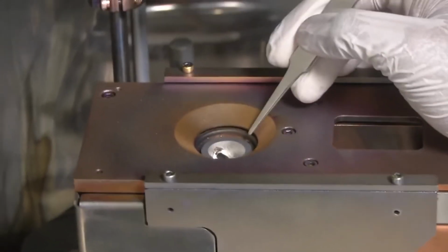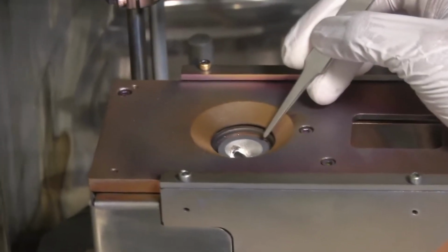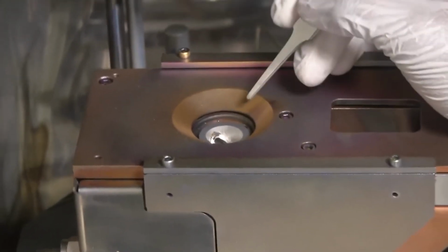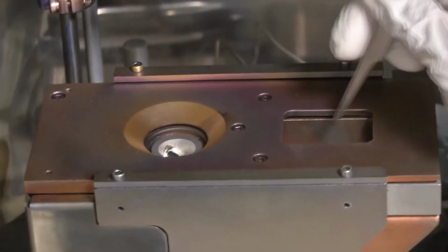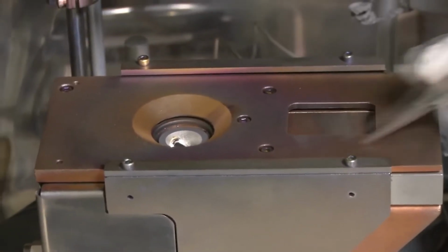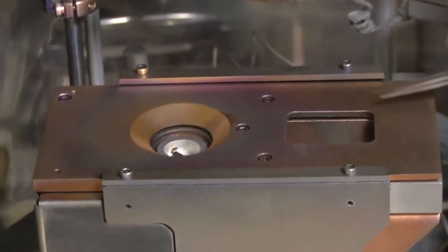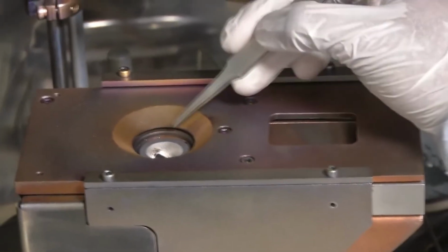As my colleague is pointing out using a tweezer, there is already a material loaded onto the crucible, and the electron beam is generated to the right of the crucible, and by applying a magnetic field which is located on the sideways of the filament, we can direct the electron beam thus generated and focus it only onto the crucible.